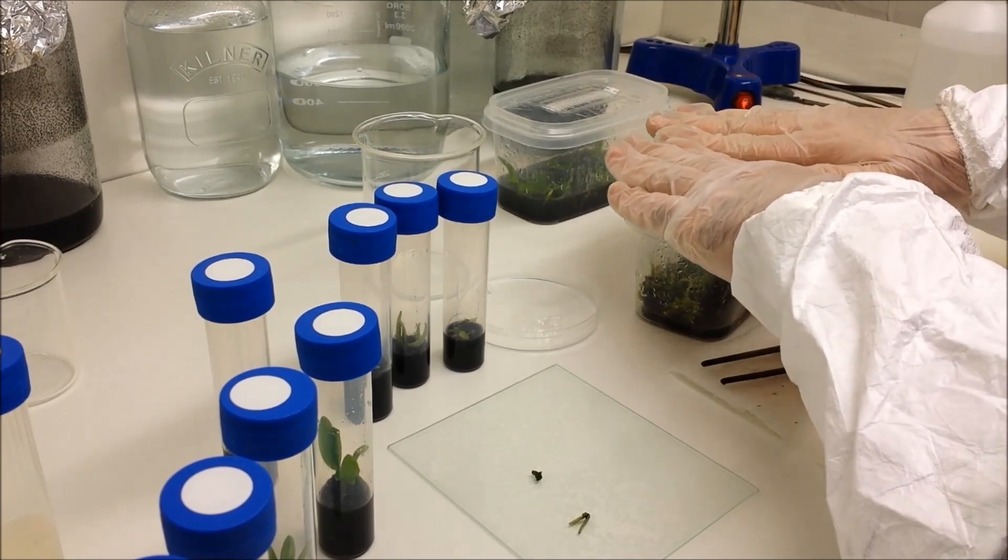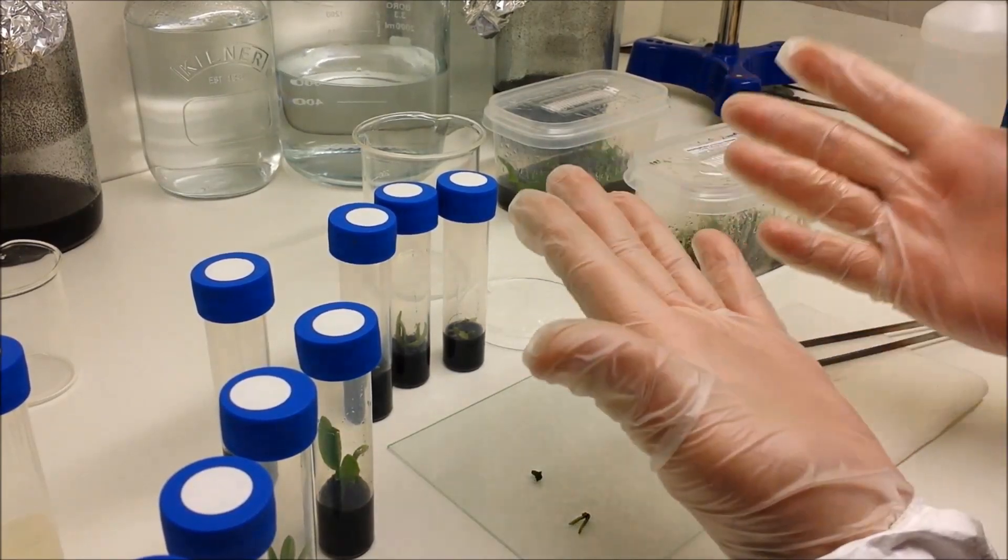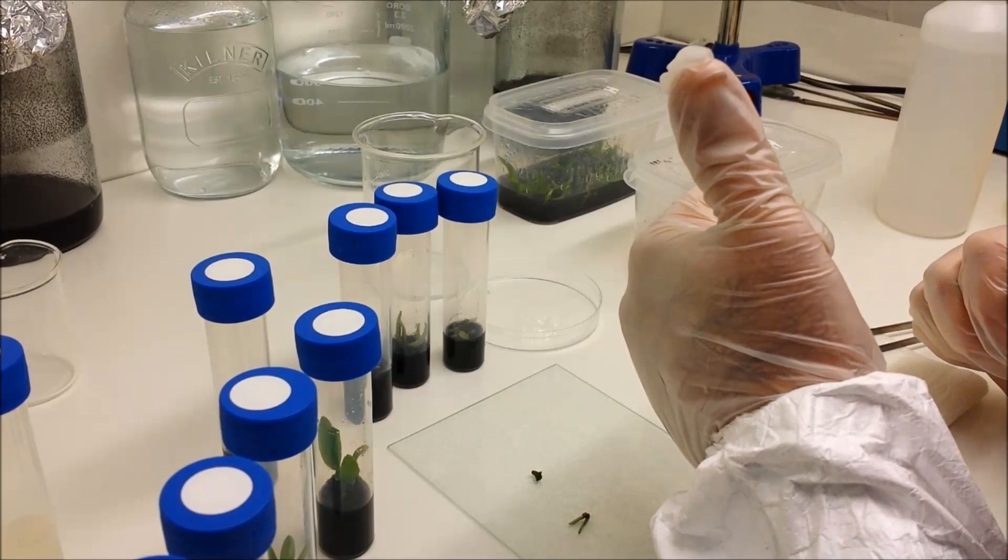Replace the lid onto your flasks so you can come back again in the future and do some more of them. Wash your hands, all done. Hope you enjoyed that. Don't forget to check out the other videos. This stuff is available from orchidspecies.co.uk.